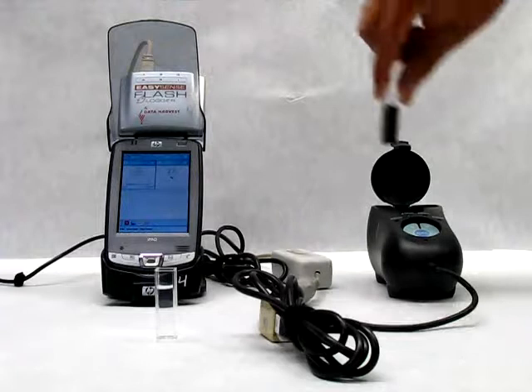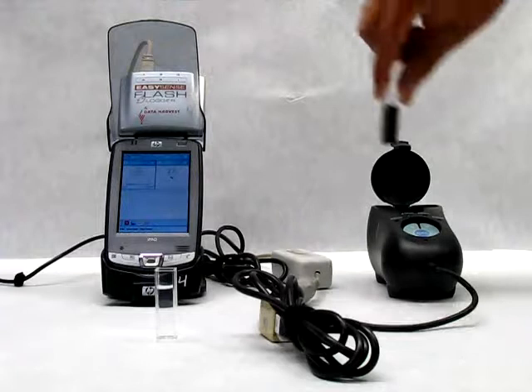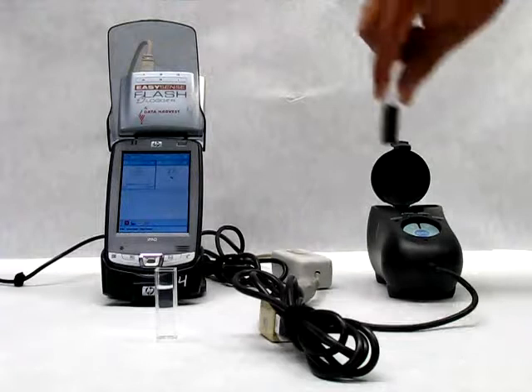Now, we can introduce our sample. The instrument will tell you which is the percentage of transmittance. You will have to repeat this for every one of your samples.